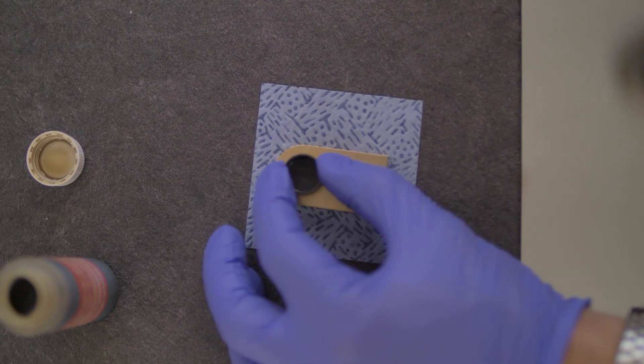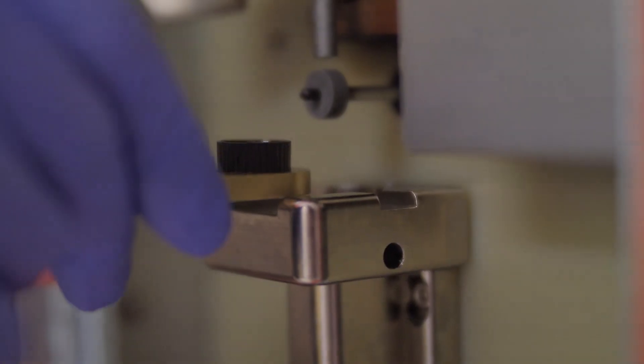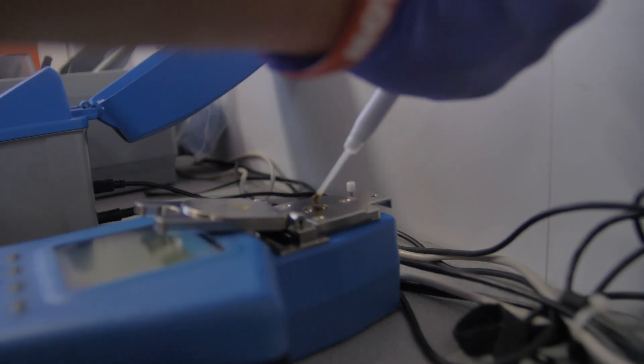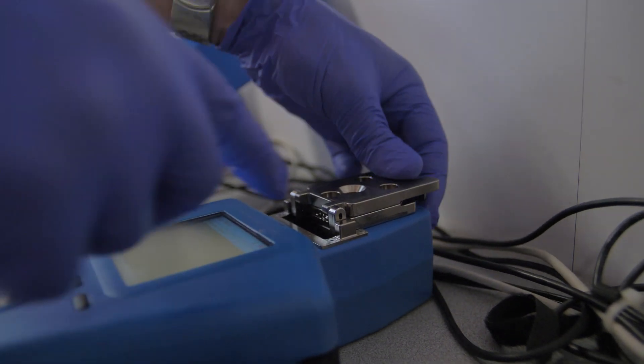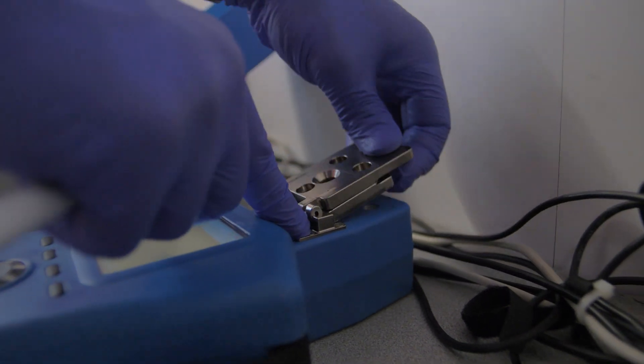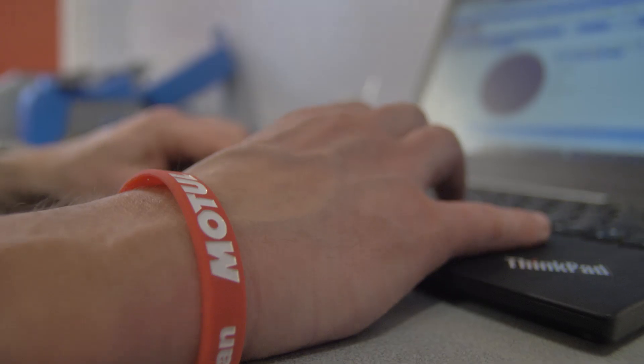The second thing is all the wear metals that we can find in the oil. For gearbox or engine materials, we can find iron, aluminium, copper — any sort of materials that are present in the engine — and see if there is any specific wear.